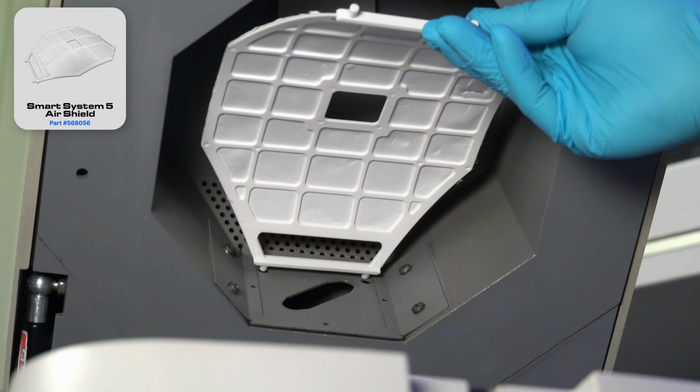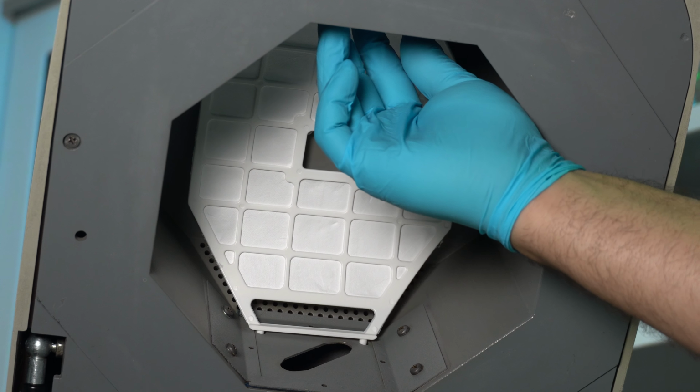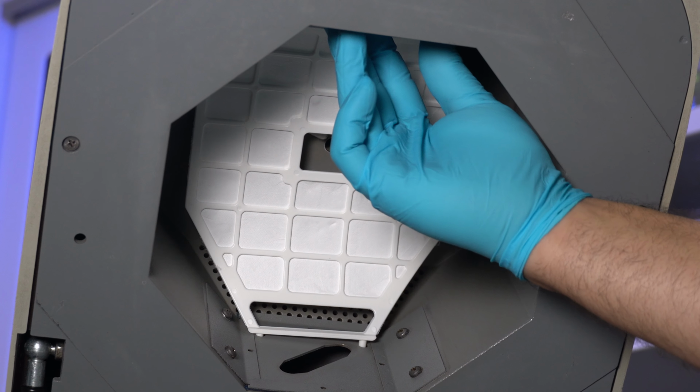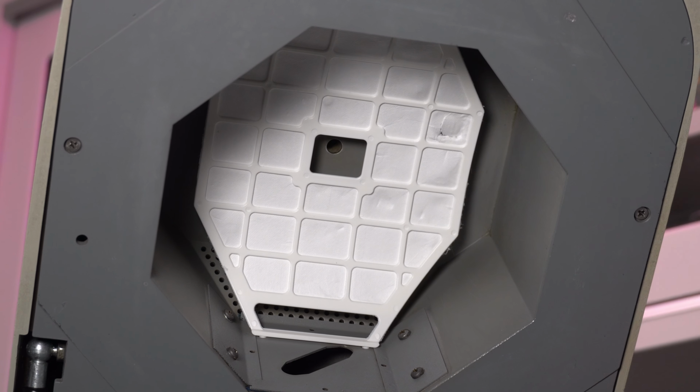the bottom and push up until they are securely in place on the opposite side. Make sure the blade isn't being obstructed by the Airshield. Following these steps will help ensure the accuracy and reliability of your test results.